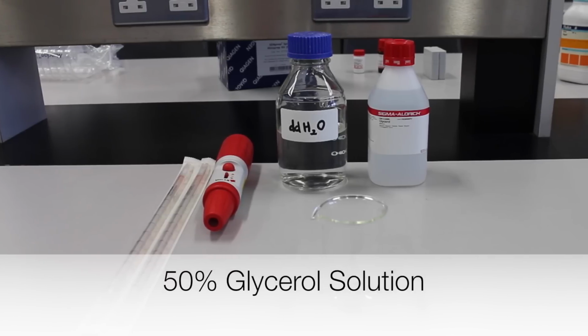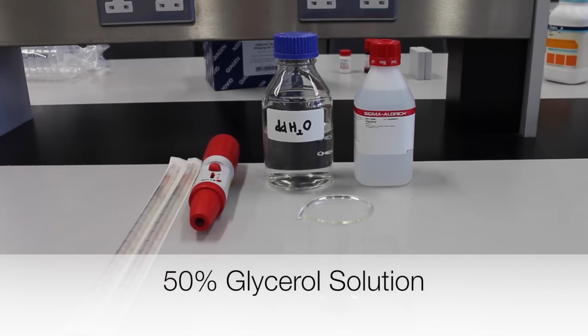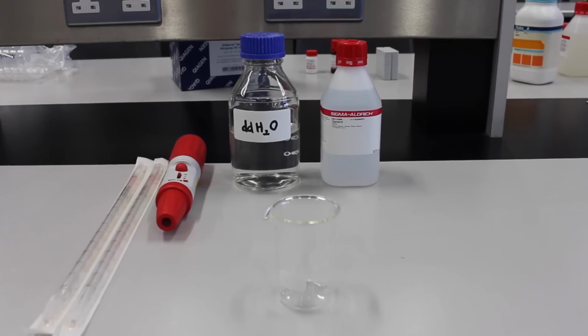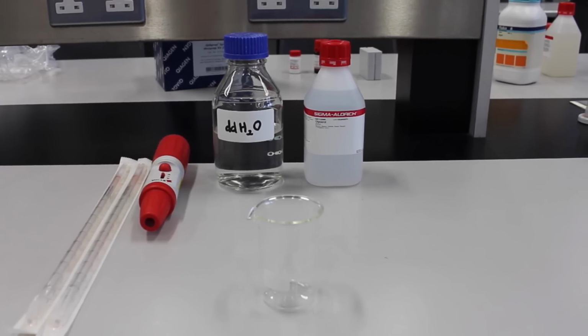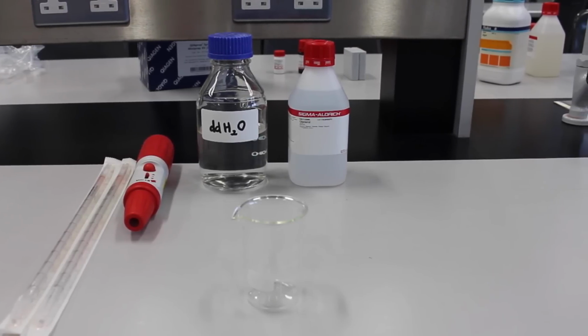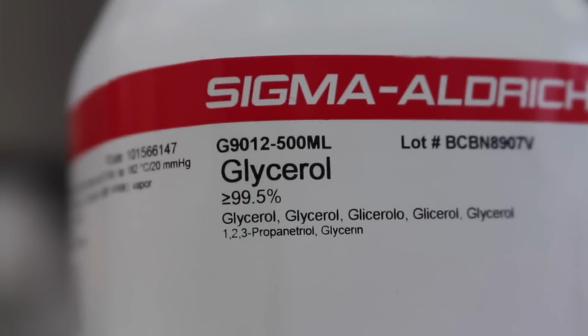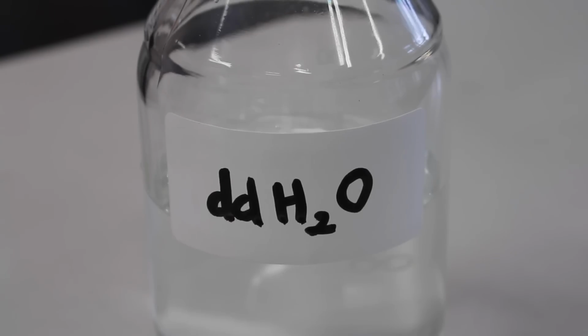Next, a 50% glycerol solution is prepared. This solution is used for making cell glycerol stocks out of bacterial strains. The presence of glycerol in the stocks will prevent damage to the cell membrane of the bacteria. To make a glycerol solution, the following are needed: glycerol and water.